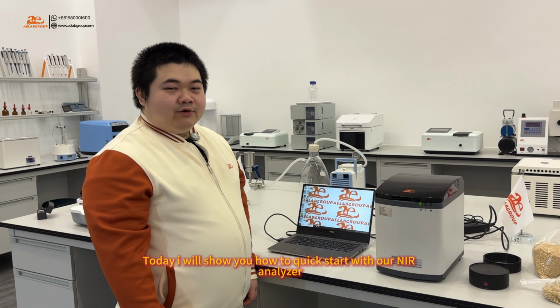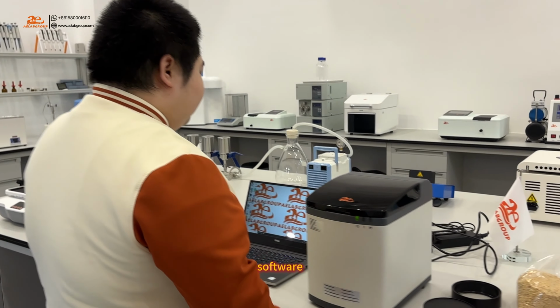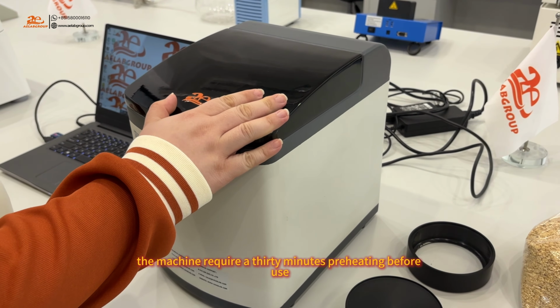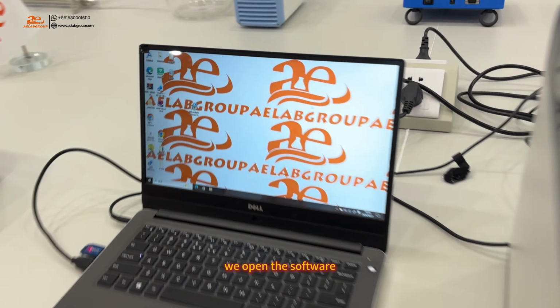Today, I will show you how to quick start with our NIR Analyzer software. The machine requires 30 minutes preheating before use, and we have done that before. Okay, we open the software.